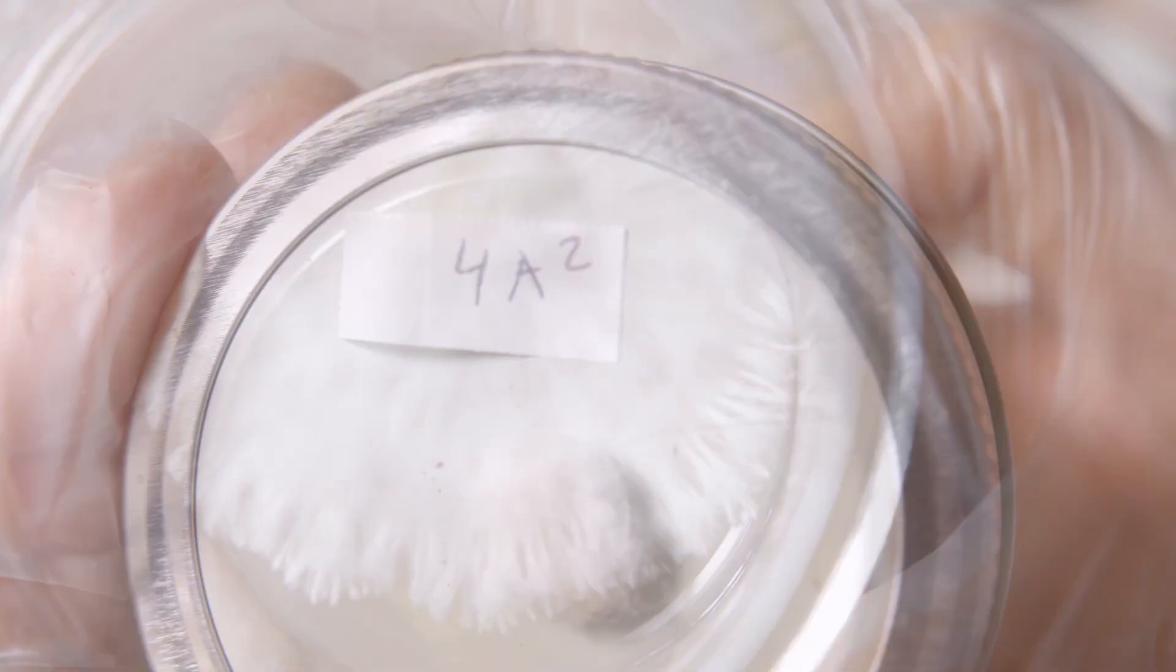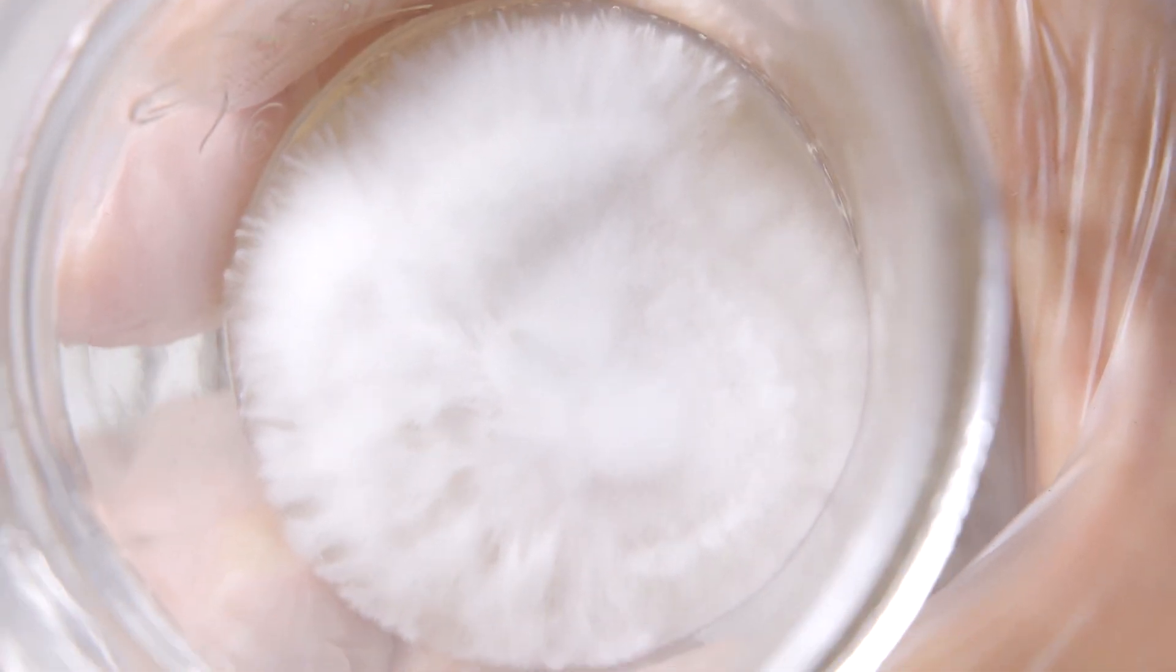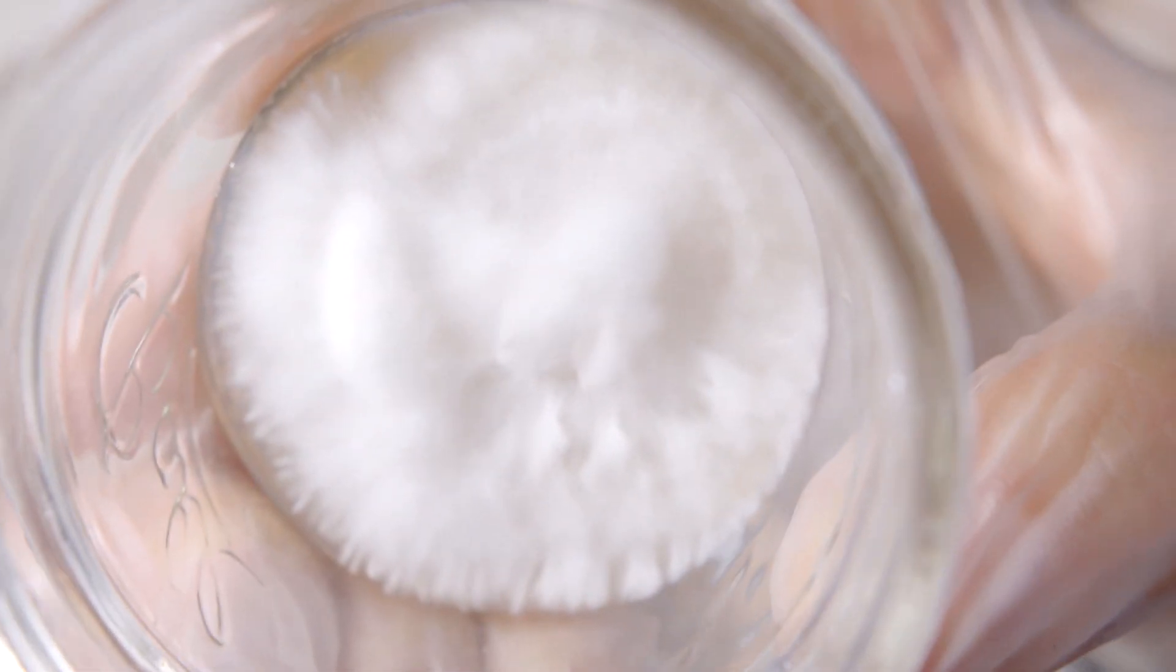Let's move on to our second plate and see how we've done. And it looks like we don't have a pure isolate yet. The best thing to do would be to continue isolating this plate until it's pure. But for now, I'm going to put it into storage and get back to it at a later time.